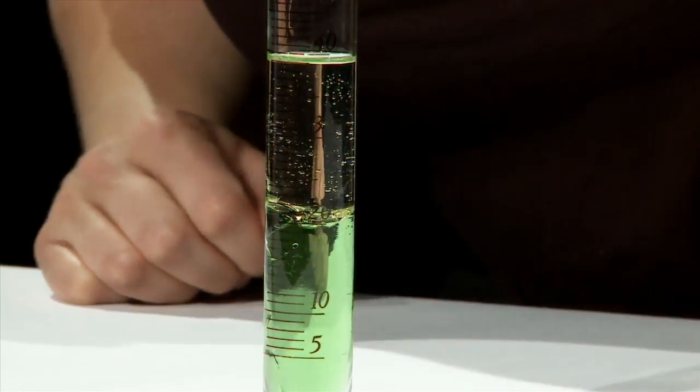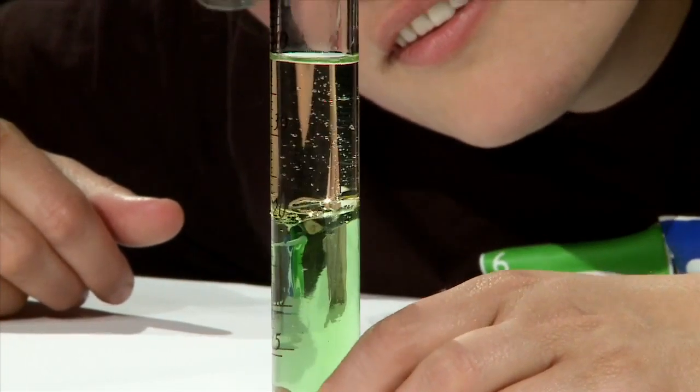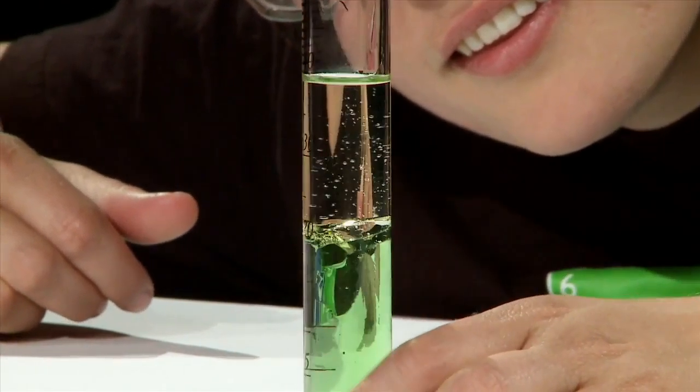Now what is the final volume of the two layers? 40 milliliters, just as we predicted.